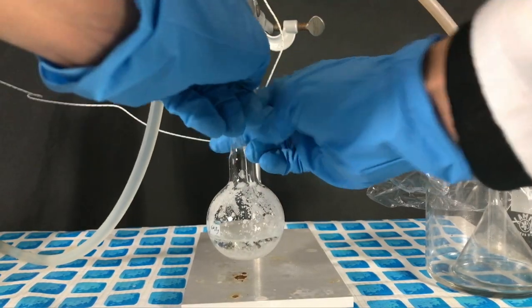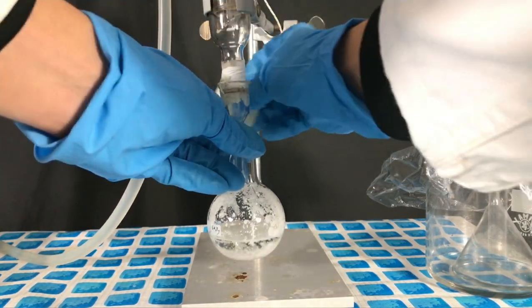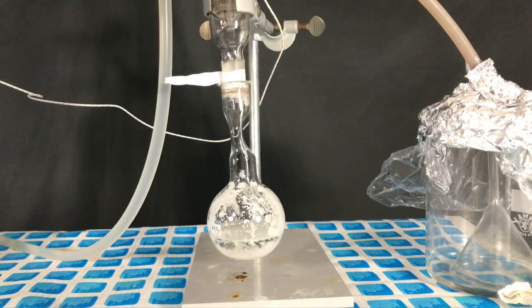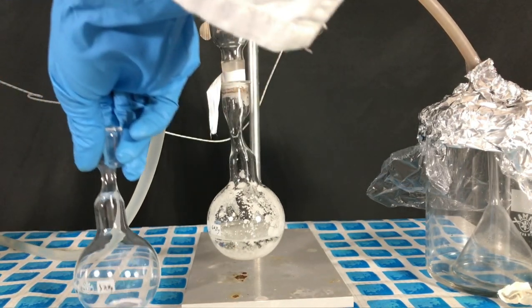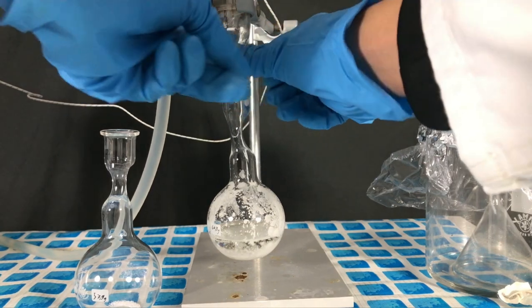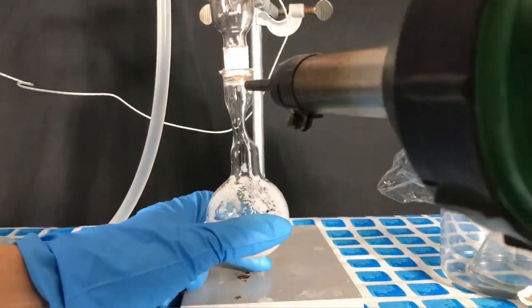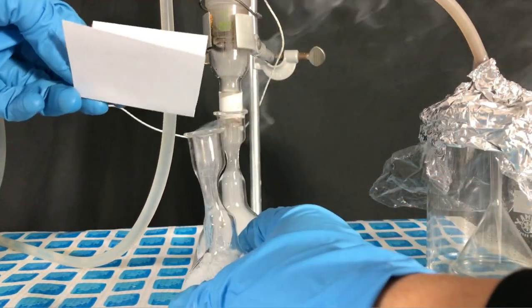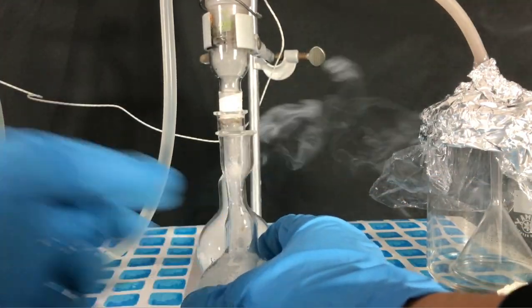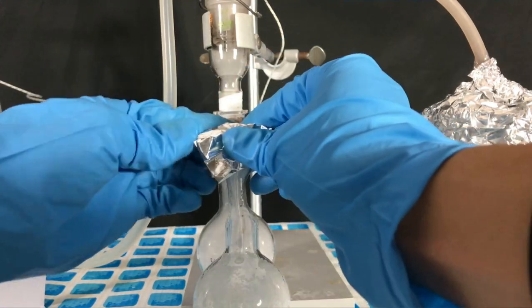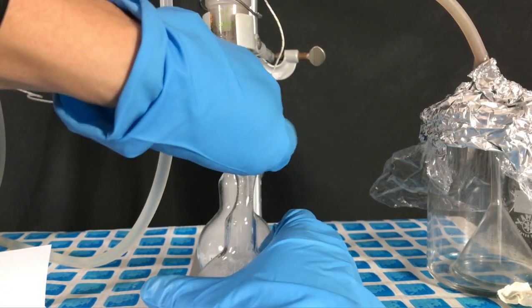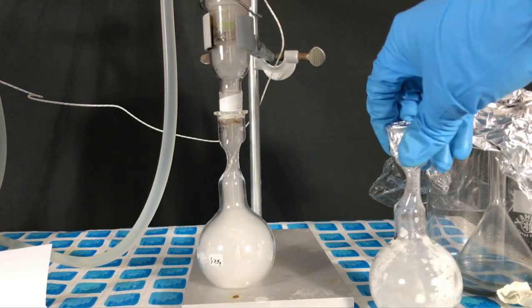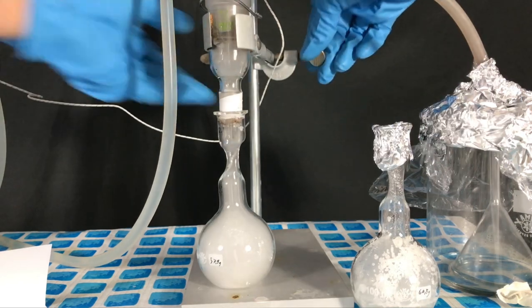When the receiving flask ampoule was full enough for my taste, I removed the tape which was used to hold it in place. To the second ampoule that we used, a small amount of boric acid has been added in advance. After melting the sulfur trioxide in the neck of the ampoule, the ampoules will be switched out. Using a heat gun, the connection between the ampoule and the apparatus was freed from sulfur trioxide. The flask was switched out and another small amount of boric acid, approximately 0.1 grams, were added to this flask. To keep the sulfur trioxide in the flask and the moisture out of the flask, we covered the opening with aluminum foil. You can have a close look at a mixture of liquid and solid sulfur trioxide.